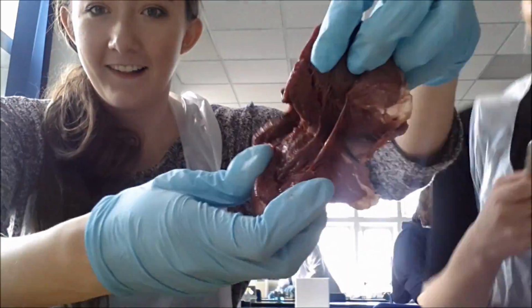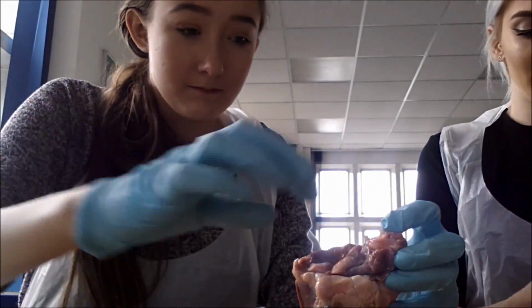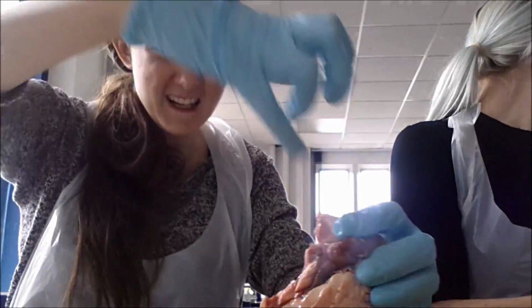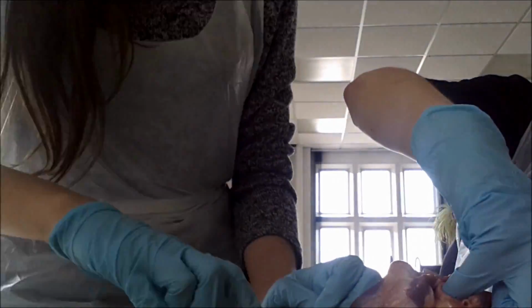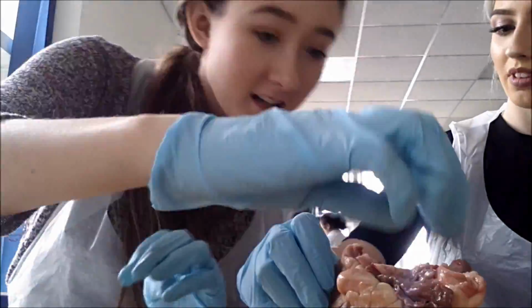The heart consists of 4 chambers: right and left atria, above the right and left ventricles. The right atrium links to the right ventricle by the tricuspid valve. This valve prevents backflow of the blood in the atrium above when the ventricle contracts. The left atrium links to the left ventricle by the bicuspid valve, and this also prevents backflow of the blood in the atrium above when the ventricle contracts.